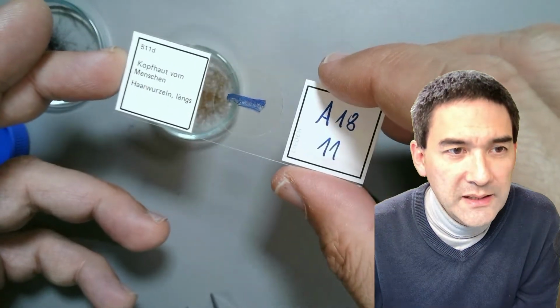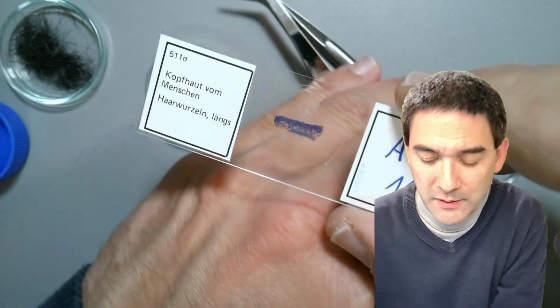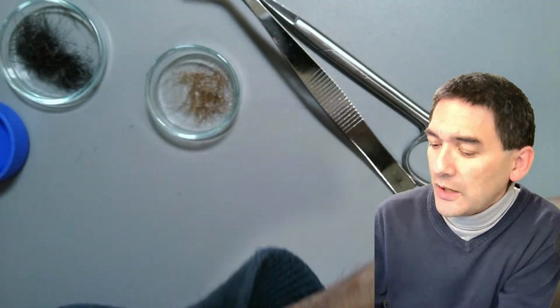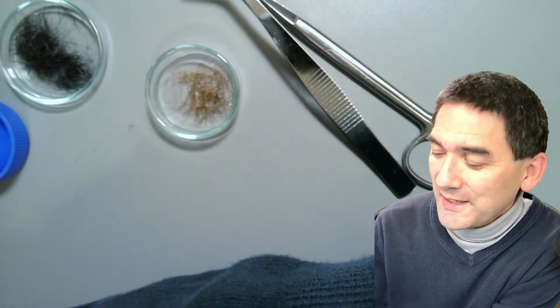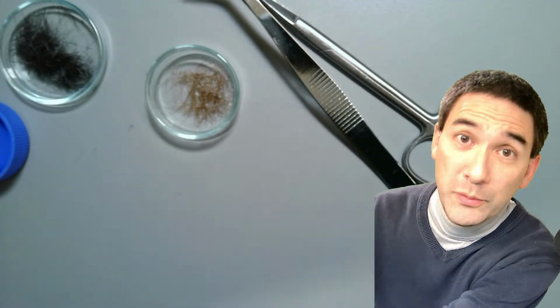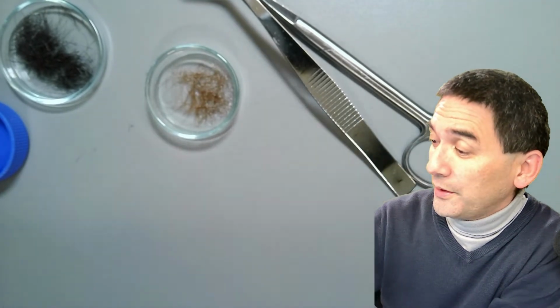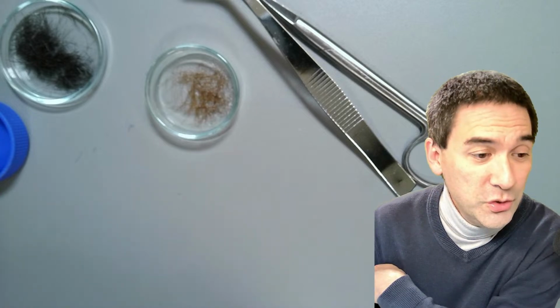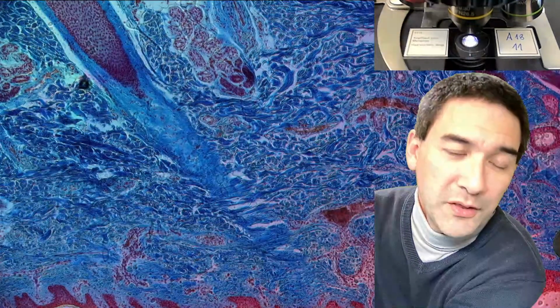It's a histological slide. It is basically the scalp of a human being, so this is actually human tissue. It's a commercially prepared slide that we also use in education. I remember that somebody once emailed me. He or she bought a set of microscope slides labeled with human, with human blood and human tissue on it, and this person was a little bit worried. I said, yeah, of course, this is quite common in the medical field, right? But the thought alone was not very comforting for the person.